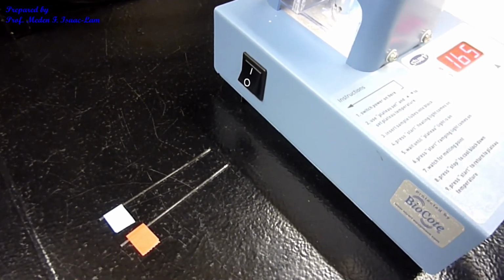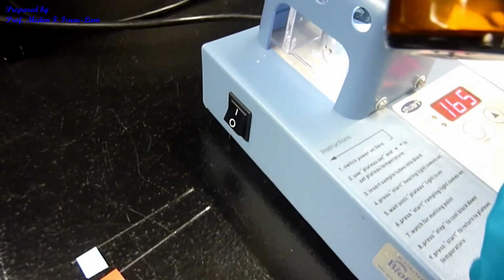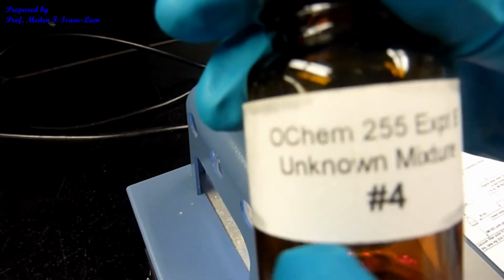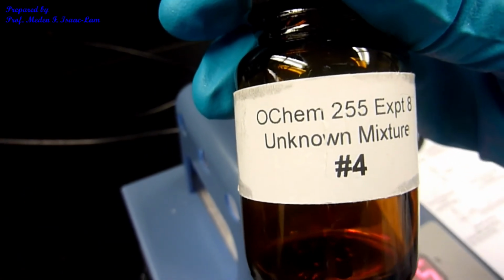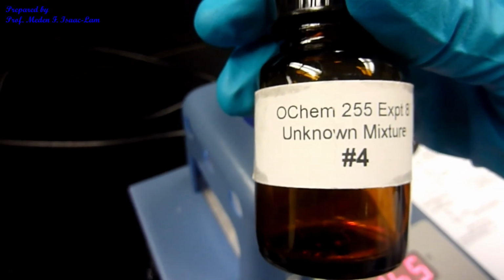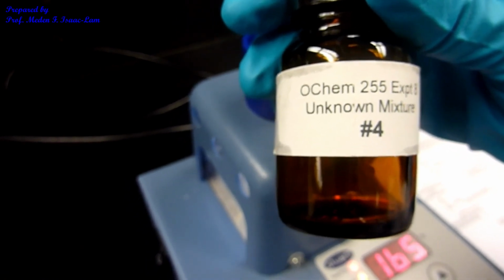If you are doing this face-to-face, each student will receive one jar with the 3-component unknown. So I used unknown number 4. Each one will have a different unknown number. So for our purposes, I will give you different unknown numbers, and I will give you data which is going to be either posted online or sent by email.